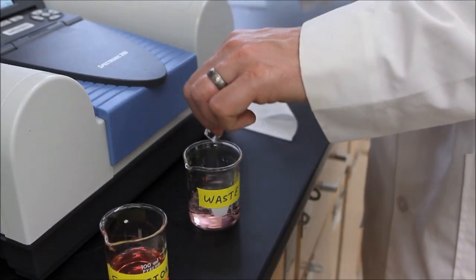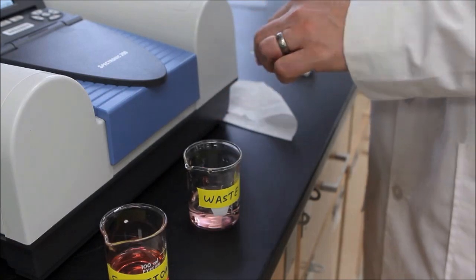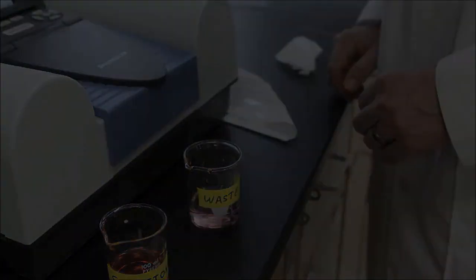Finally, set the clean cuvette near the instrument to air-dry. Thank you.